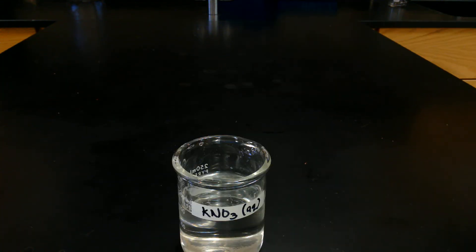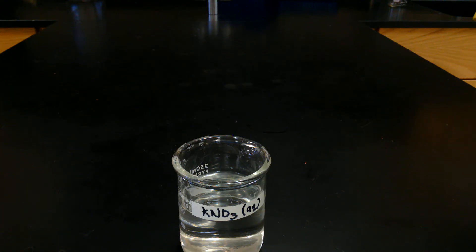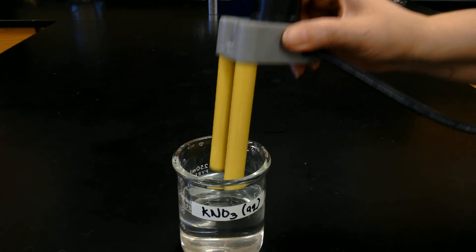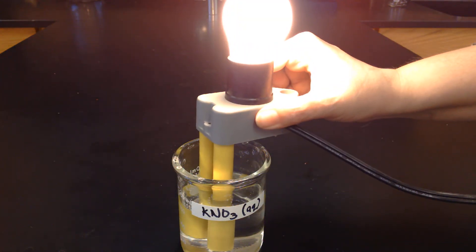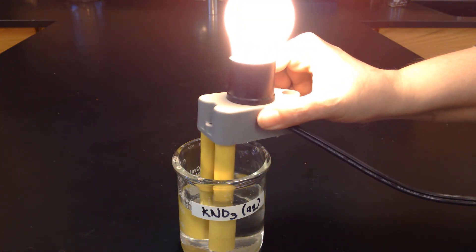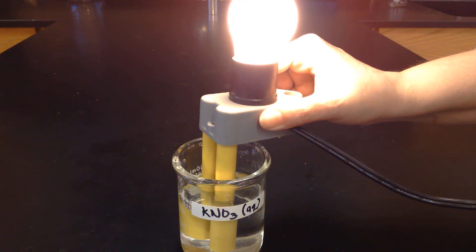Now we're going to try some potassium nitrate aqueous, which is KNO3. Nice and bright. Go ahead and make your observations of that.